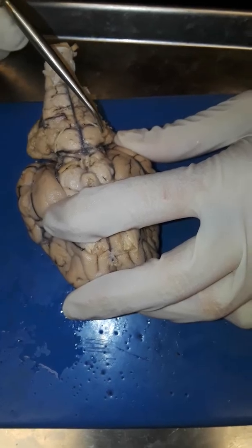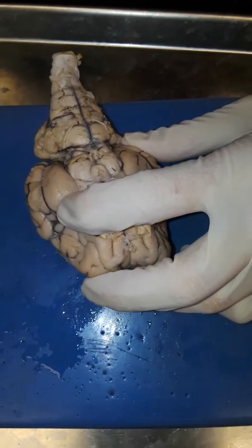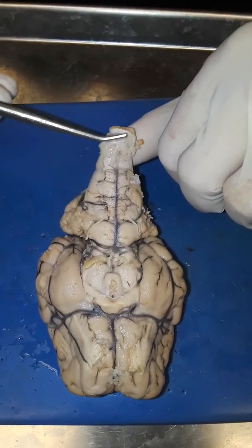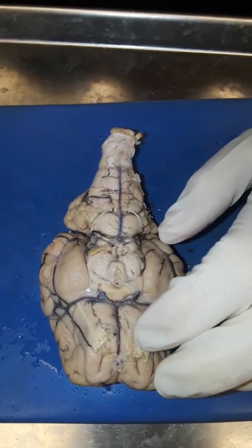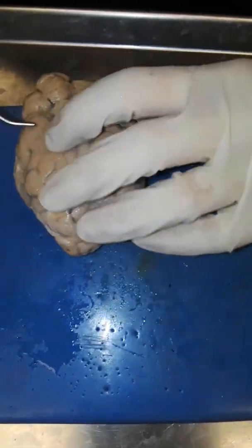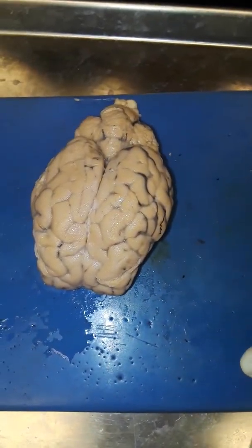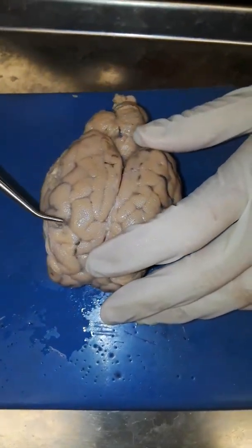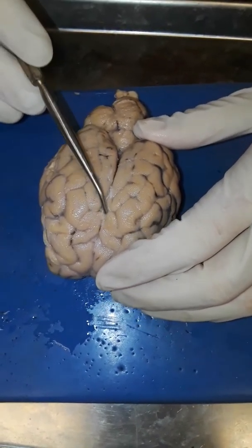And the spinal cord. The dura mater is the tough white covering of the brain — that's not shown on this, but you know it when you see it — and the pia mater attaches that to the brain.